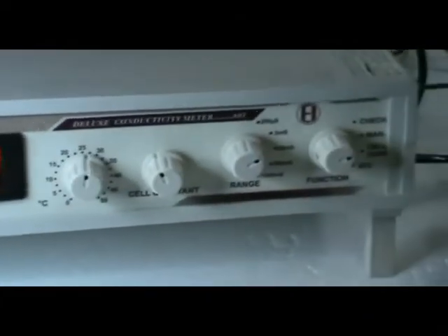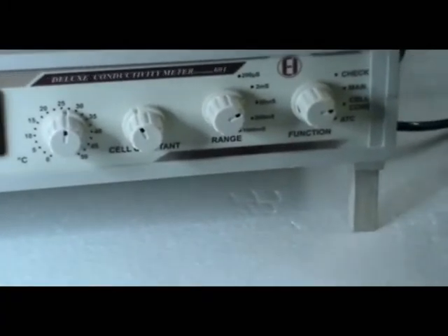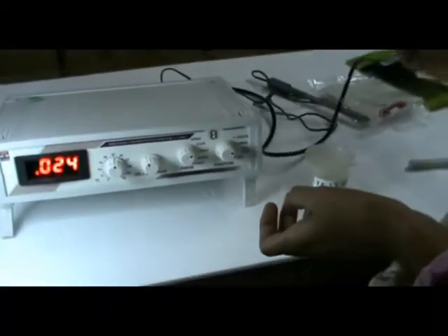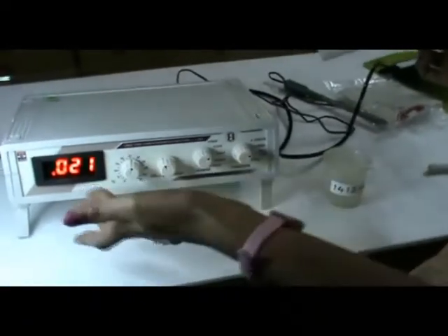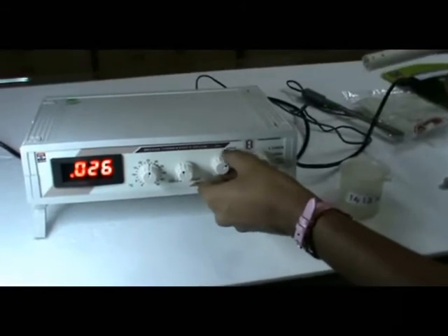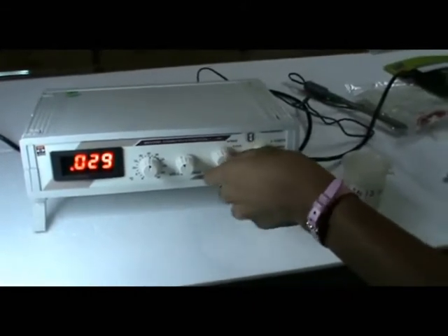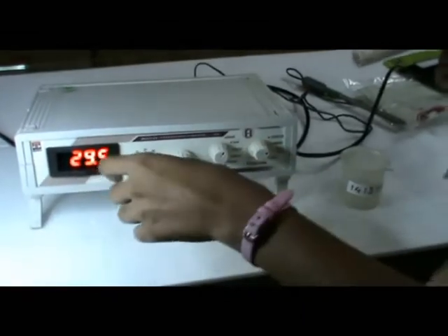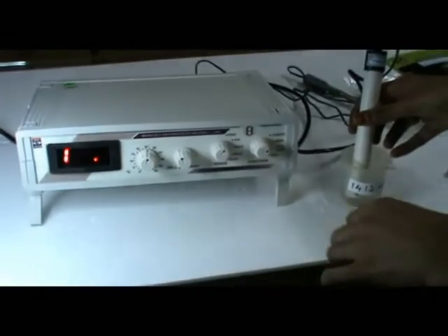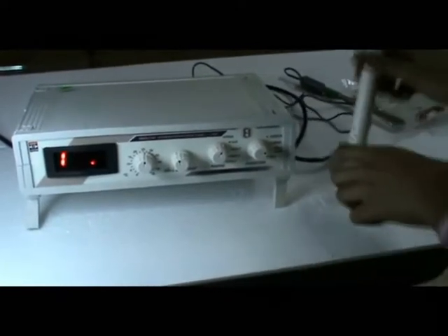I will clean the cell with distilled water using a tissue. Then I will change to direct reading and then to the second range. Over range is indicated by 1.00 with one dot — this means the reading is out of range. I will then change to the second range.